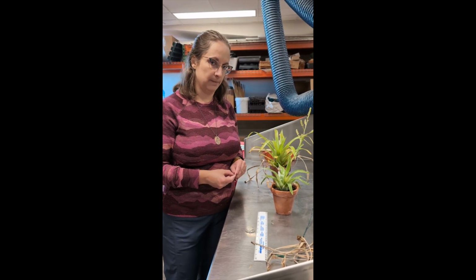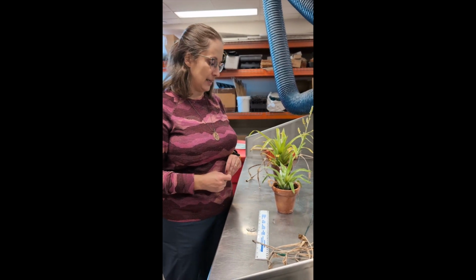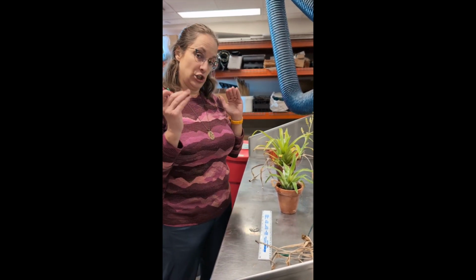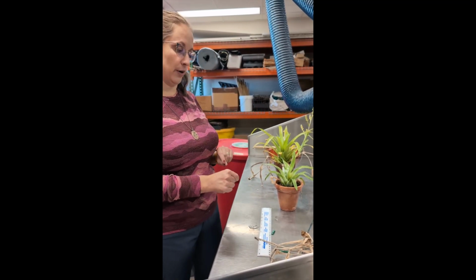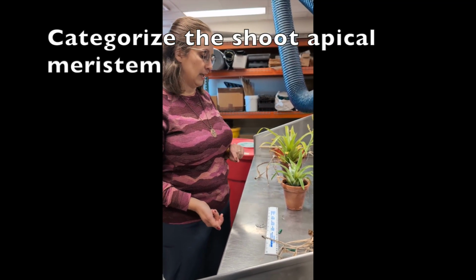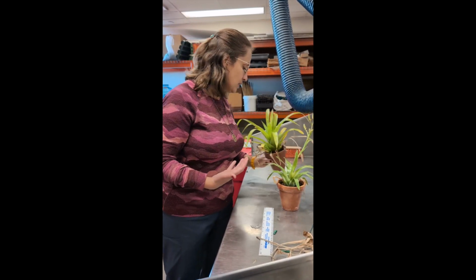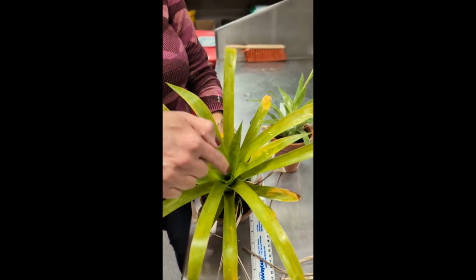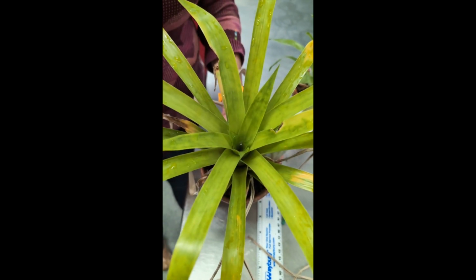The final thing I would want you to do when you're taking data is to check in on these meristems. So check the shoot apical meristem of each rosette and sort of categorize it. So in this case, for this individual, all I see is water and leaves, leaves, leaves down to there.